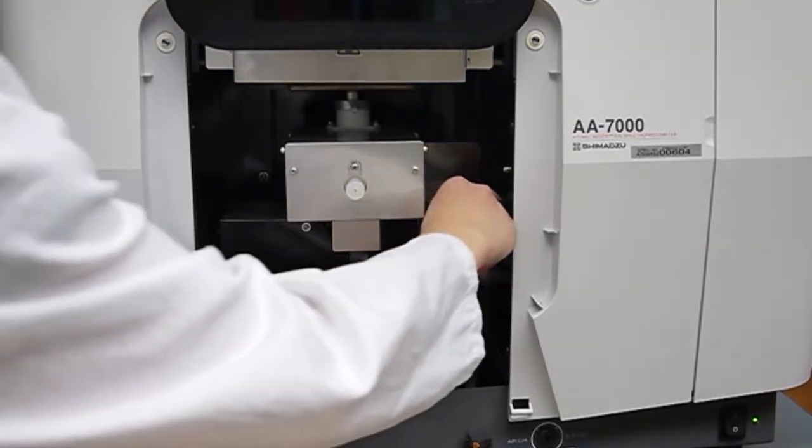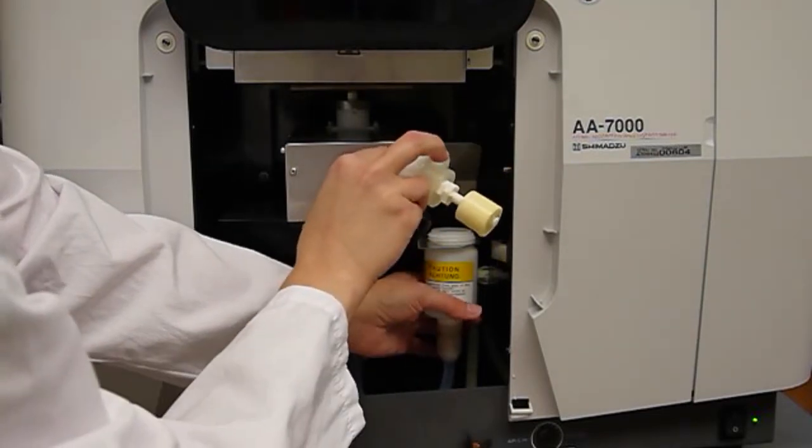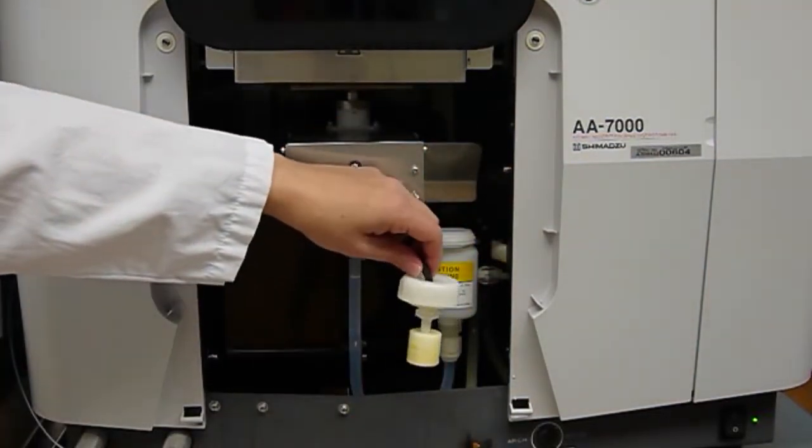This is the drain sensor. Well, this is the drain. This is the drain sensor. There, so now I've lifted it above water. I have to go click OK on the screen.